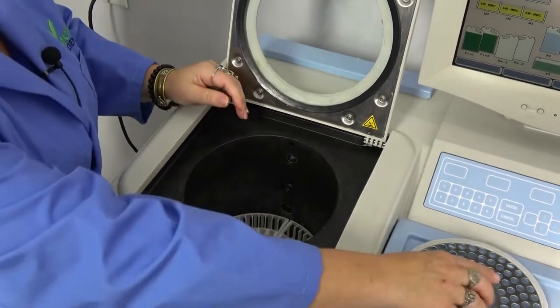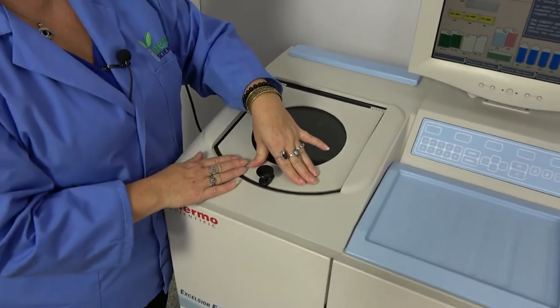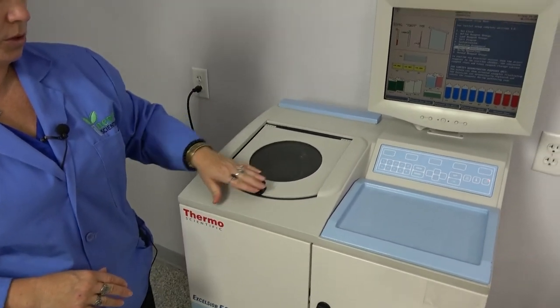Put that back in and the lid on. Snap that shut. It does know when the door is open and closed.